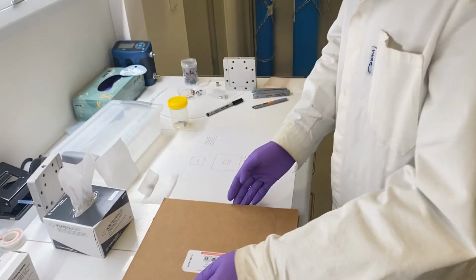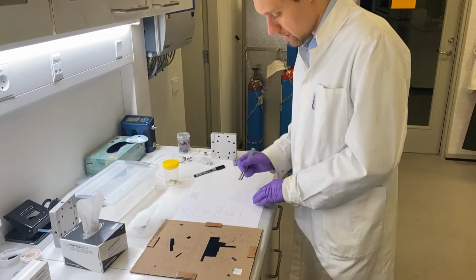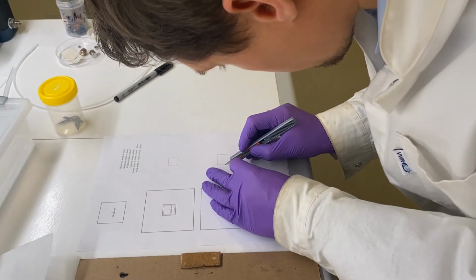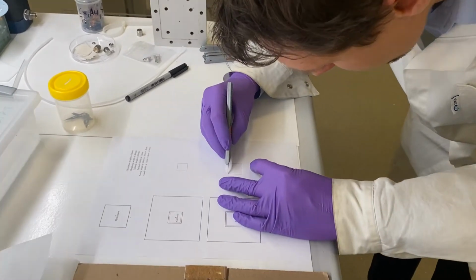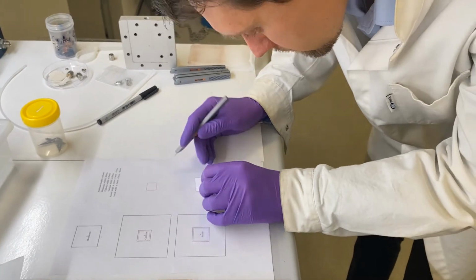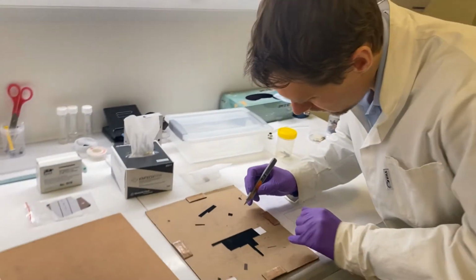So that is a good thing to remember. When cutting this one, it comes in these big sheets. What I will do is that I will cut the square out first and then use that one to cut it. And I have here again a knife dedicated for iridium oxide. Of course, we should find somewhere to cut it so I'm not wasting too much.